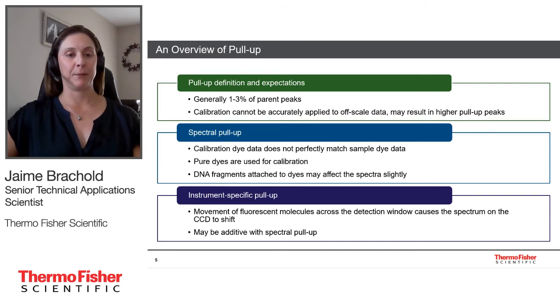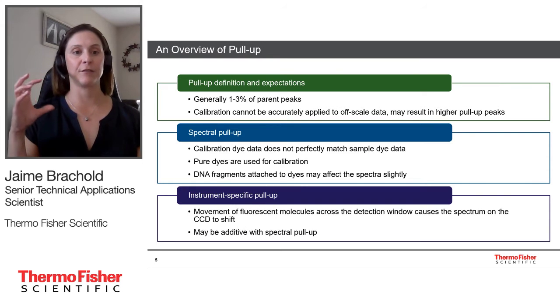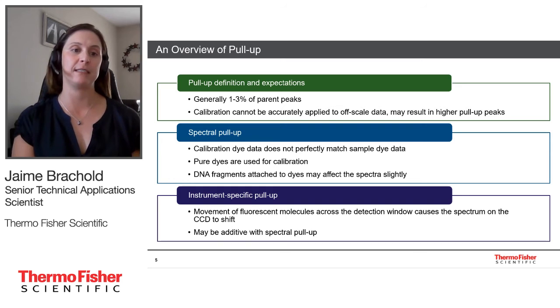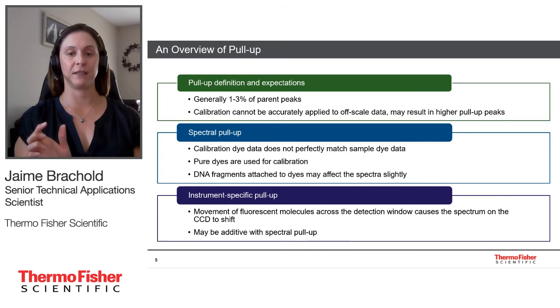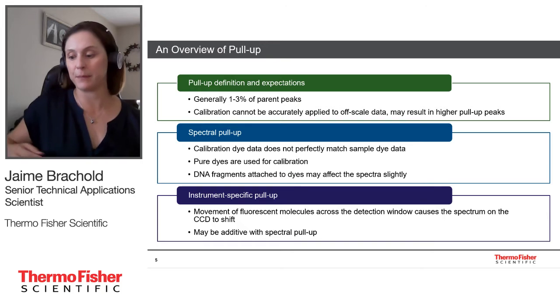When we talk about instrument-specific pull-up, it's a little bit different. Instrument-specific pull-up all has to do with the way that the fluorescent molecules move across the detection window. So as the fluorescent tagged fragments move across the detection window, center in the window, and move out of the window, the spectrum shifts on the CCD. And what you end up seeing in the raw data is a sinusoidal shape underneath the parent peak. And then in the analyzed data, rather than seeing the pull-up peak centered under the parent peak, it will be shifted. If there is instrument-specific pull-up and spectral pull-up in the same dye channel at the same time, they would be additive. So you would see maybe a single pull-up peak, but the percentage might be slightly higher.